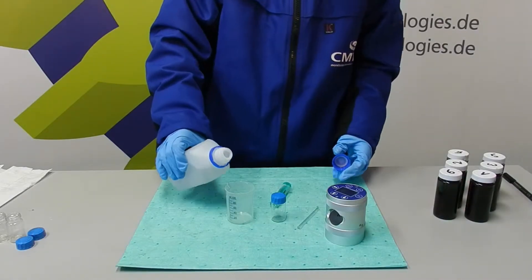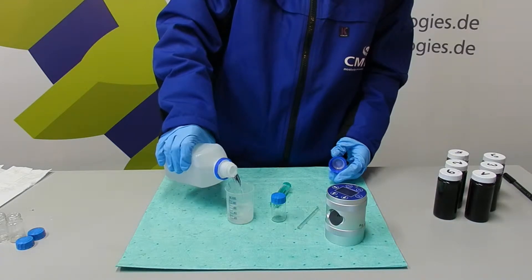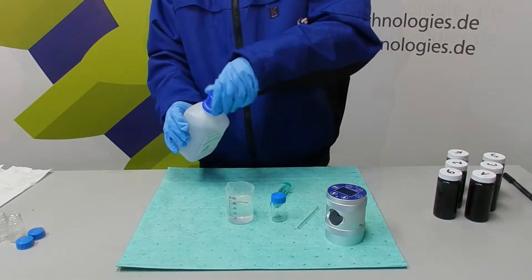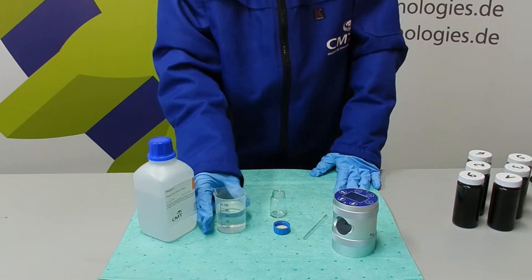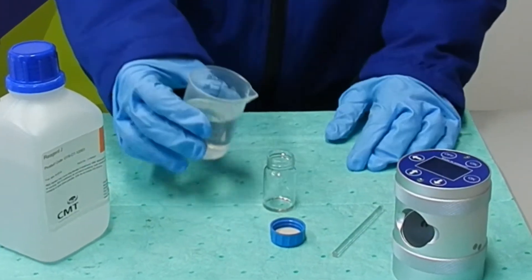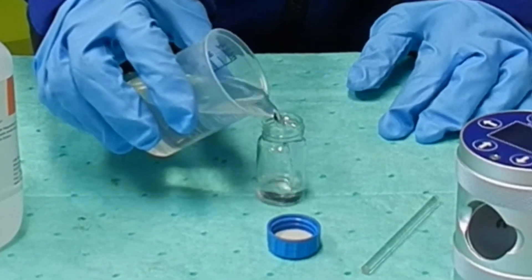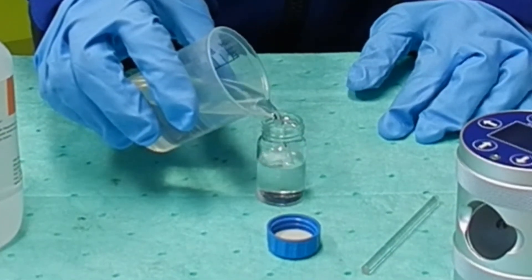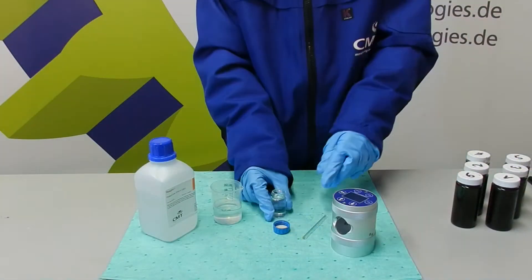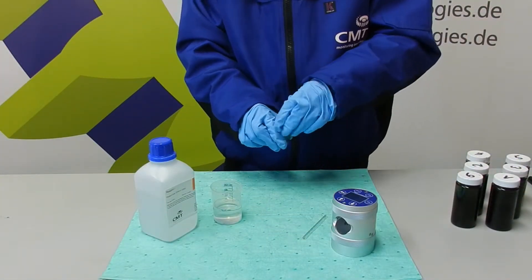Fill some reagent J into the 100 milliliter beaker provided. Fill one glass tube until the bottleneck with reagent J. Close the glass tube. Your glass tube might have a different cap without a thread.